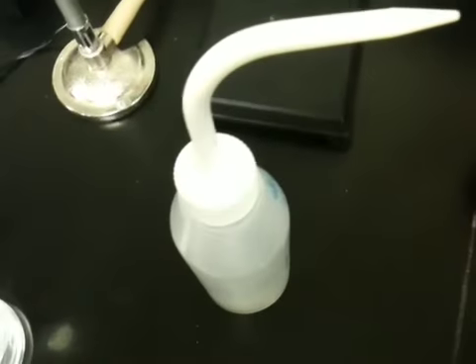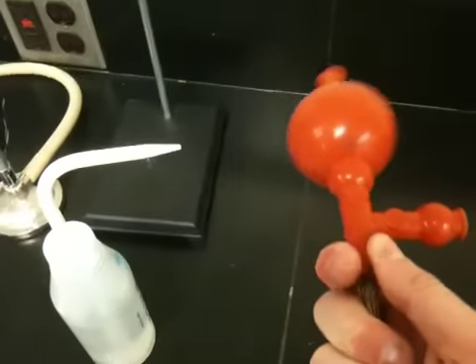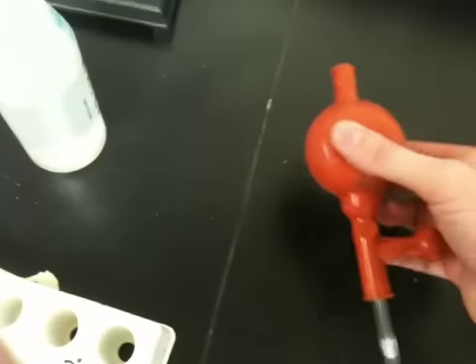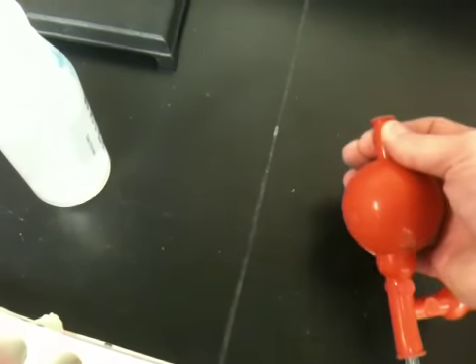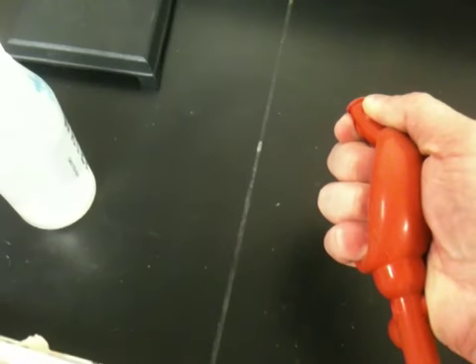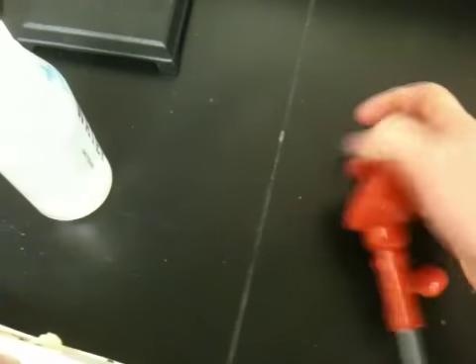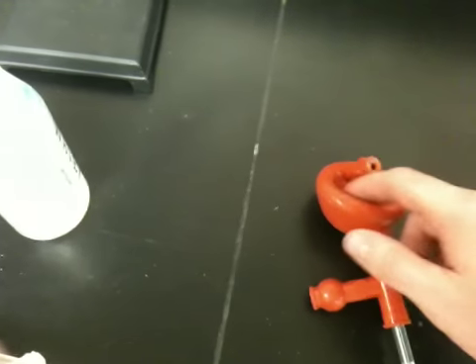So what I'm going to do is take this pipette here and put it into the valve. I'm trying to do this one-handed, which is not recommended at all. I'm just going to show you how to practice transferring liquid. When you take any pipette, you squeeze it, and then you let go and it draws up the liquid. What this does is, you pinch the top, which opens the valve, and then I squeeze the bulb and squeeze out the air through the top, because that's the only valve open. Then I let go of the valve, and then I let go of the bulb, and because all 3 of these valves are closed, no air is allowed to get back in there. So in a sense, I'm reducing the air pressure in the bulb, which will allow me to draw up my liquid.